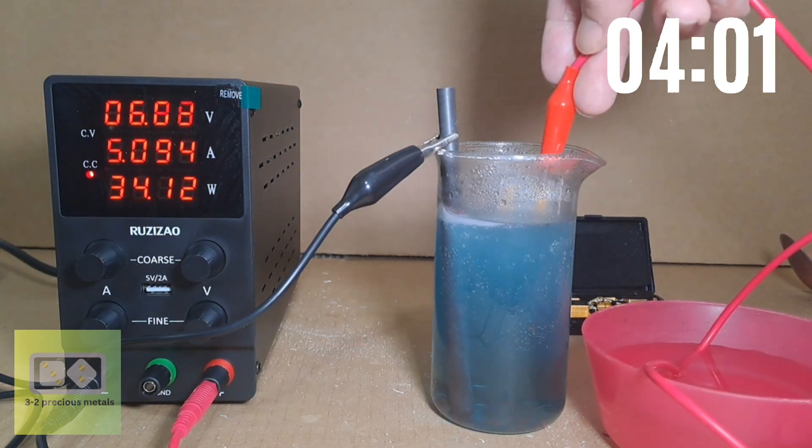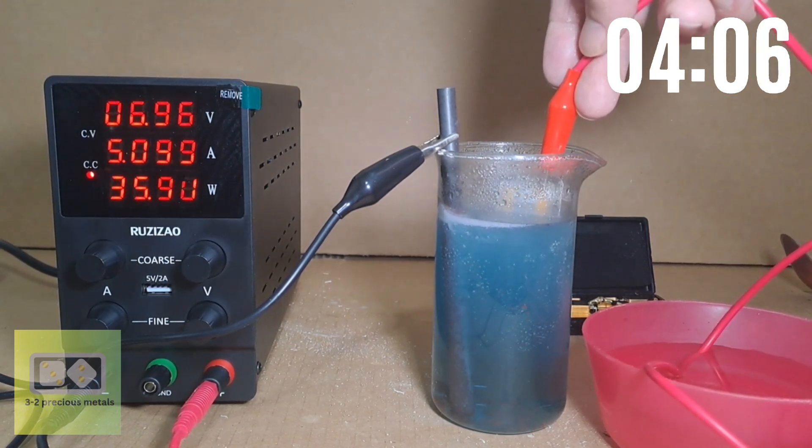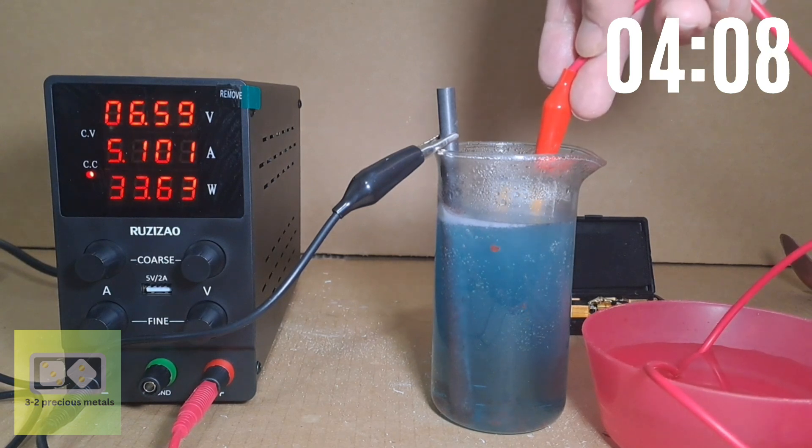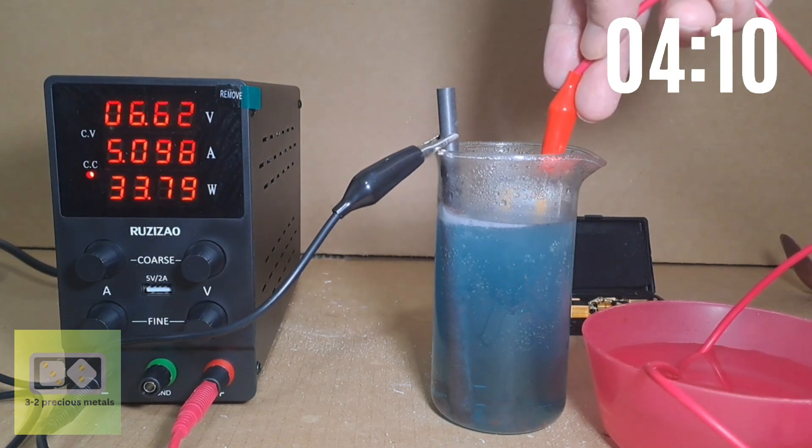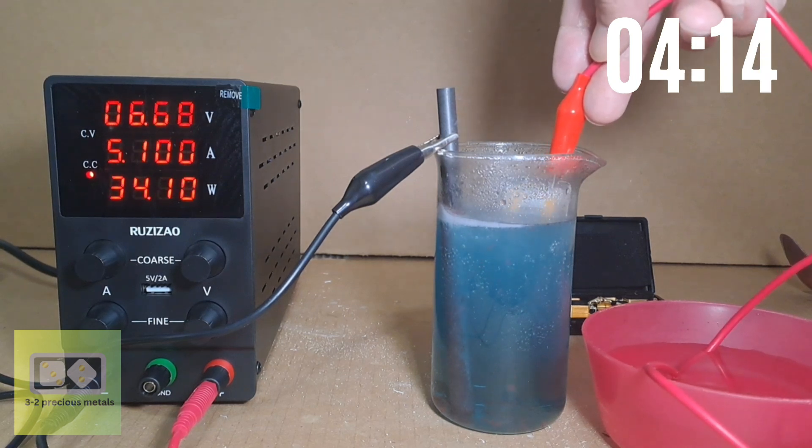Let's take a look at what's happening in my experiment. The first thing that I have noticed is there is a lot of bubbling happening. This is because oxygen is being produced at the anode, and hydrogen is being produced at the cathode.